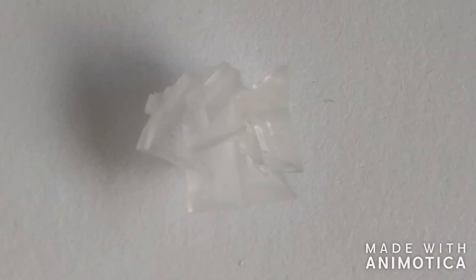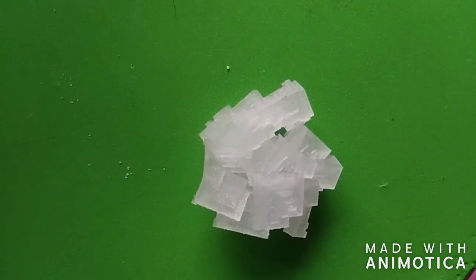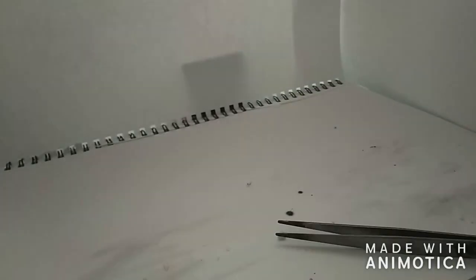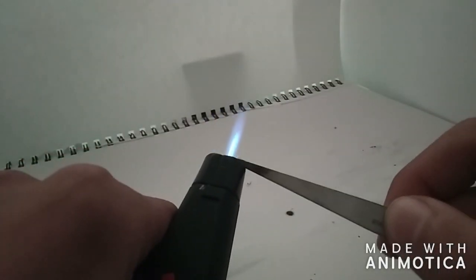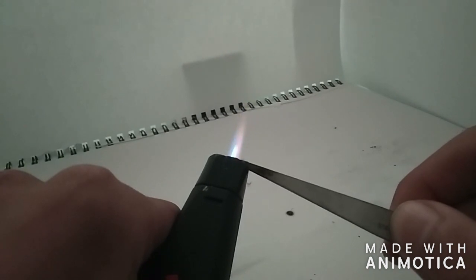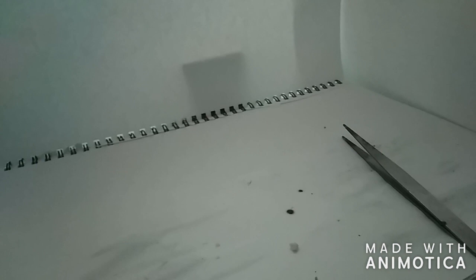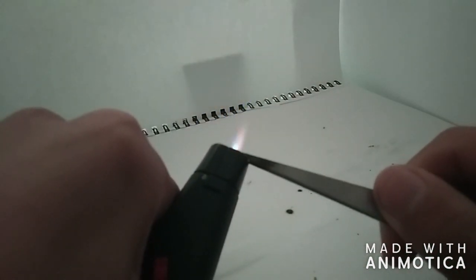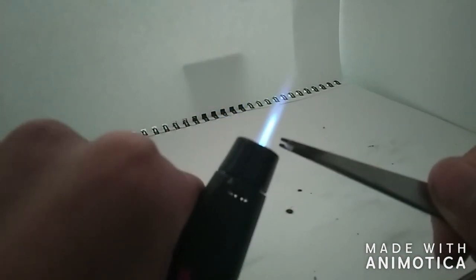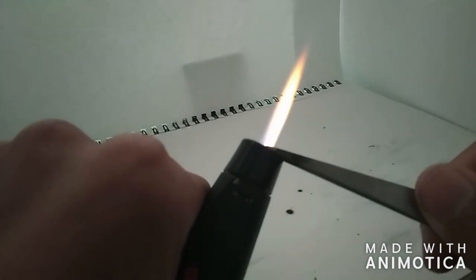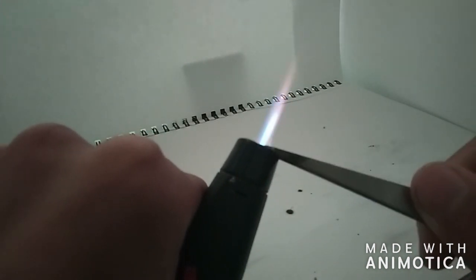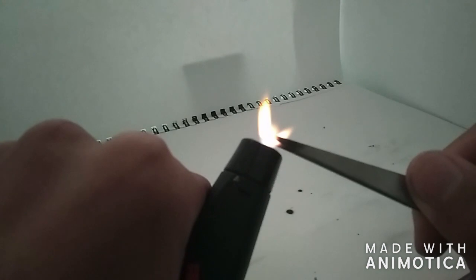And yeah, just to prove that it was somewhat purified, we can see a faint lilac purple which suggests there is potassium chloride. But if I put the whole thing in there, we can see that it turns into a yellowish-orange. That is because of sodium contamination. The color of burning sodium covers up the burning of potassium.